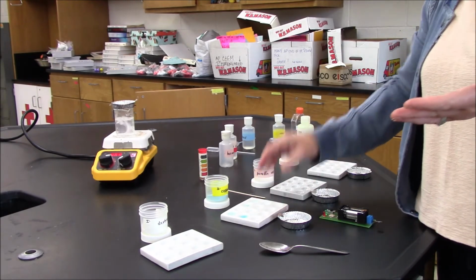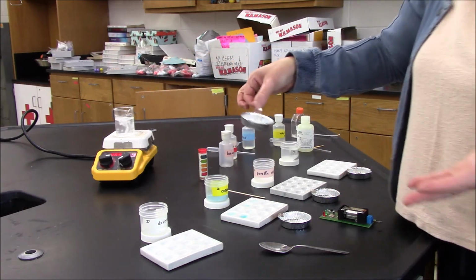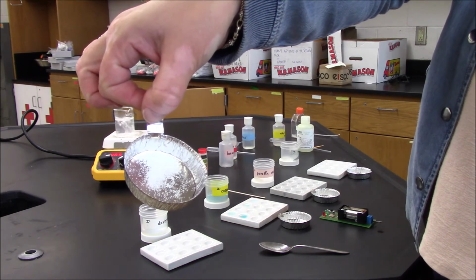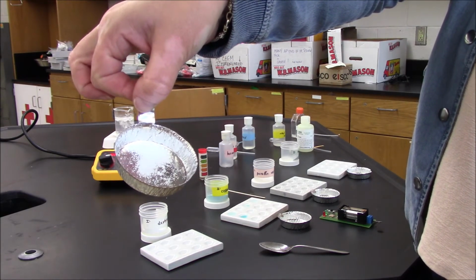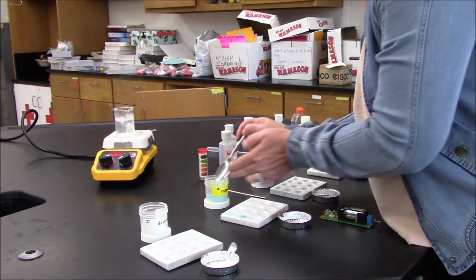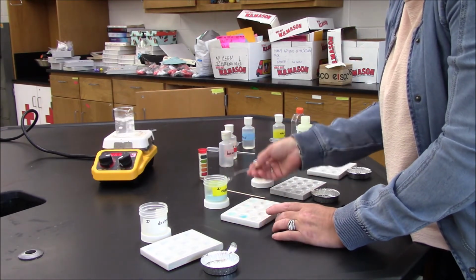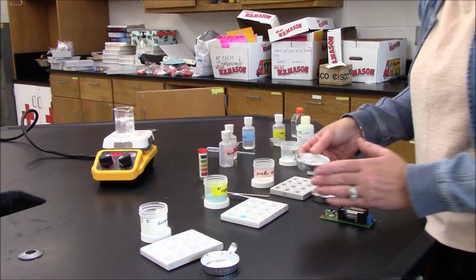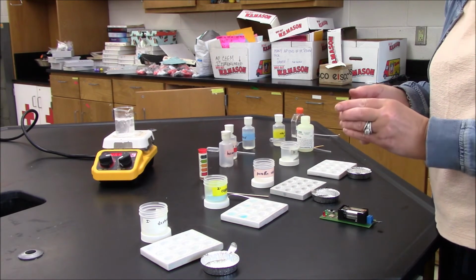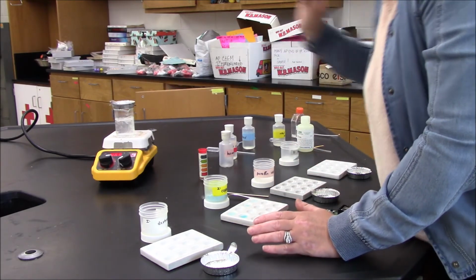Okay. I'm ready to do my melting test. Nothing happened to the dextrose, so for dextrose, I can say that it has to melt at a temperature above 100 degrees Celsius. Let's try a little bit here with the copper 2 sulfate, and I'm just going to try to spread it out. I'll let it sit, and I'll do my other tests.